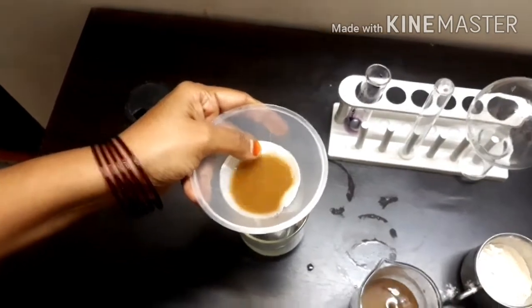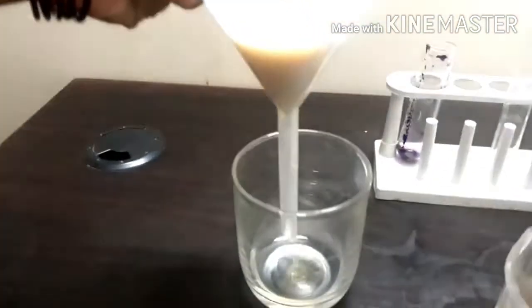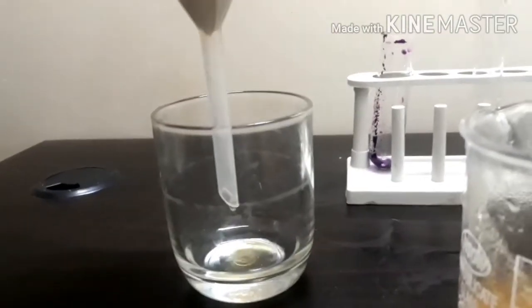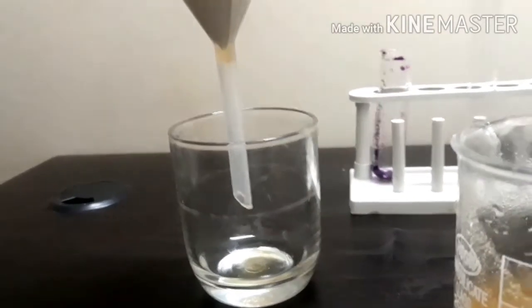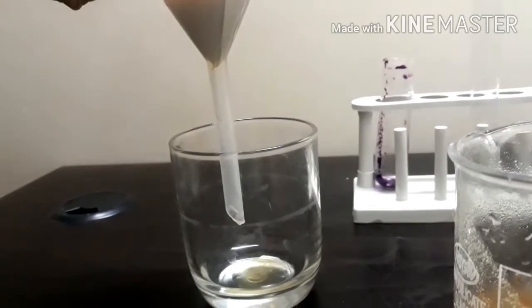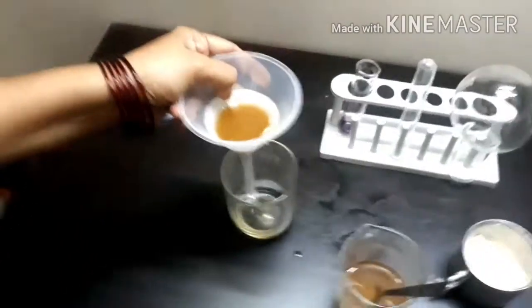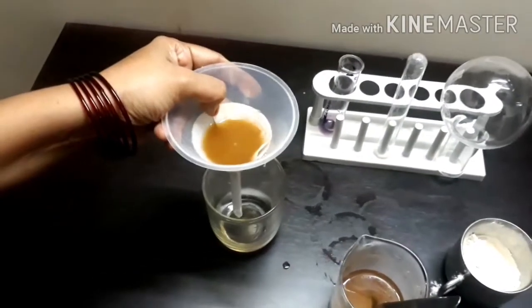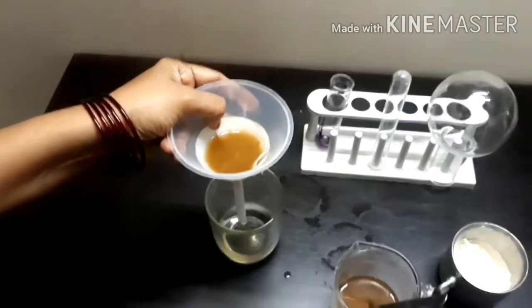Cells also act in the same way while allowing substances to pass through the plasma membrane. Here, the filter paper is acting as a plasma membrane. By performing this activity we can understand the nature of the plasma membrane.